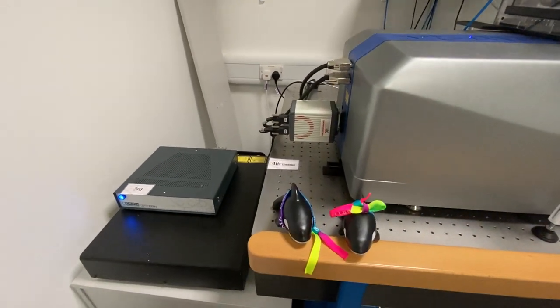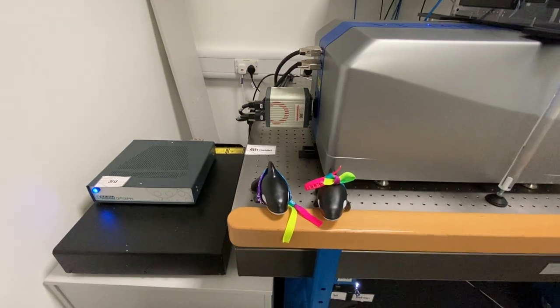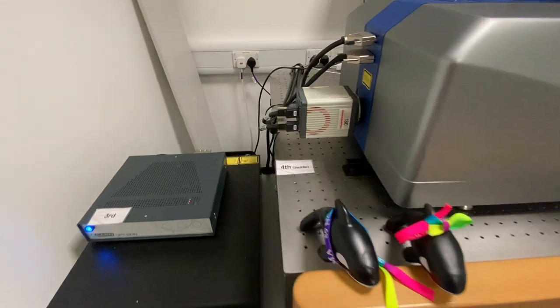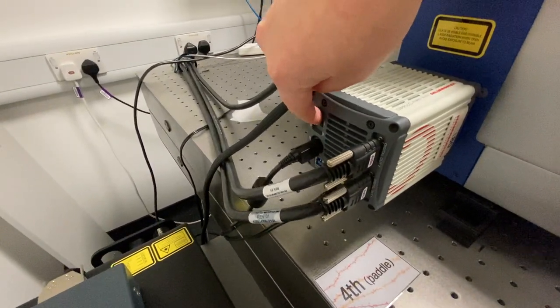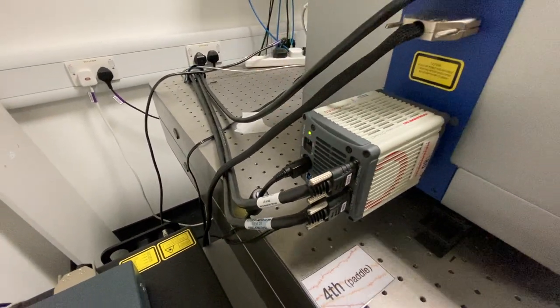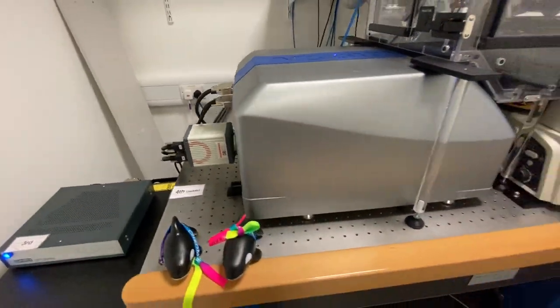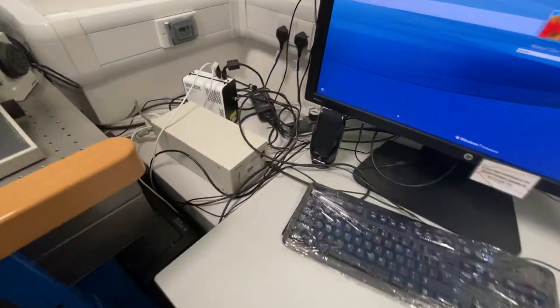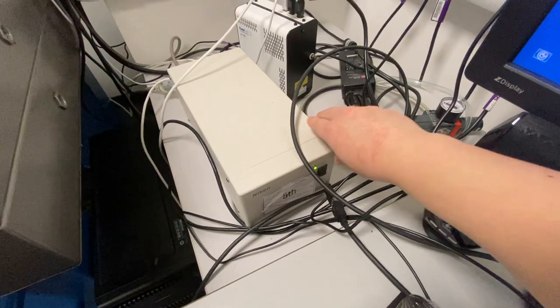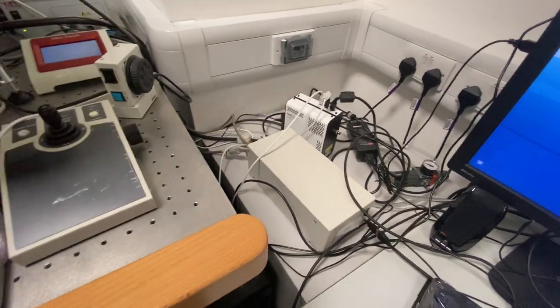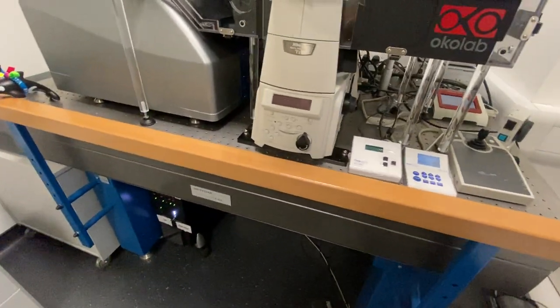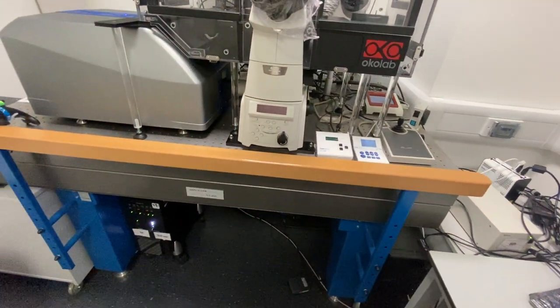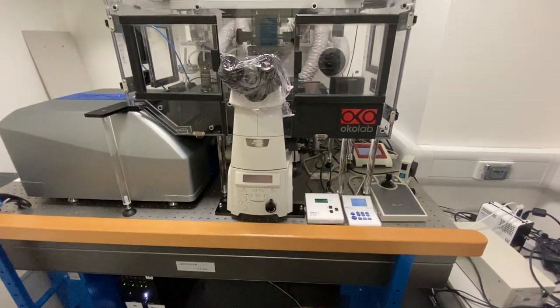Wait another five seconds. So after the fifth button, you can switch the main body of the microscope on.